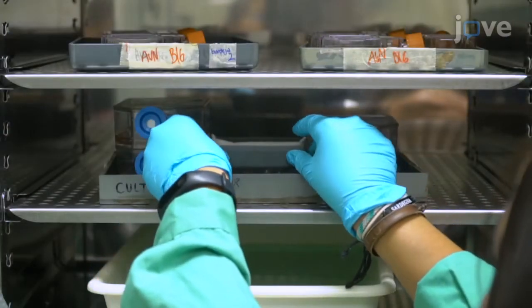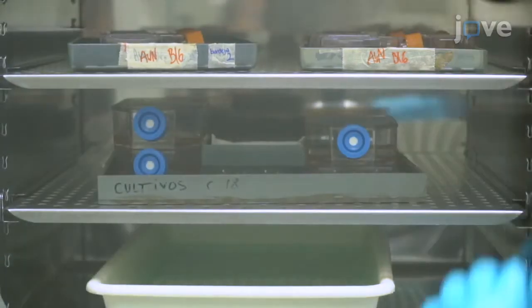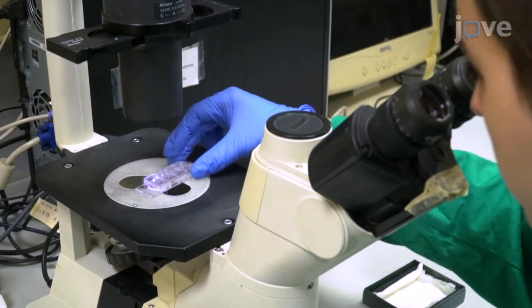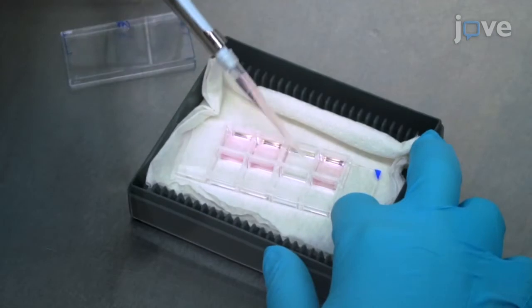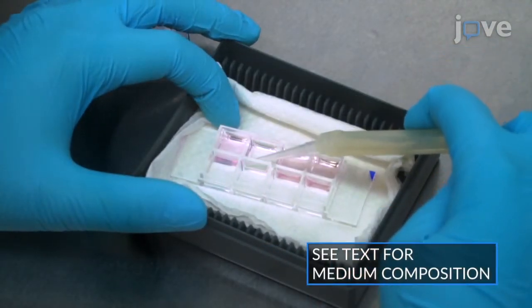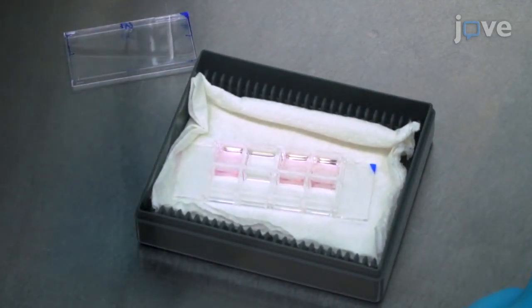Incubate the chamber slide at 37 degrees Celsius with 5% carbon dioxide for 30 minutes to 1 hour. After this, gently shake the chamber slides on the microscope to ensure that the Raji cells are adhered. Wash each well carefully with warm complete cell culture medium to eliminate excess cell tracker blue. Ensure that the Raji cells are adhered to the bottom of the plates, and they display gaps among each other, and they are not confluent. 50–60% of cell confluence is appropriate.